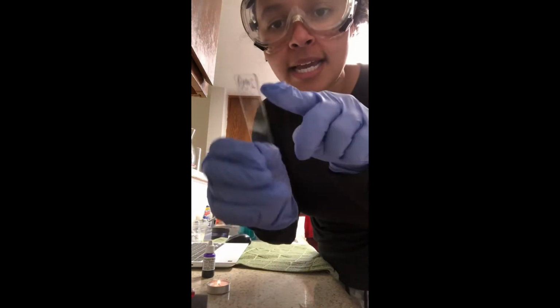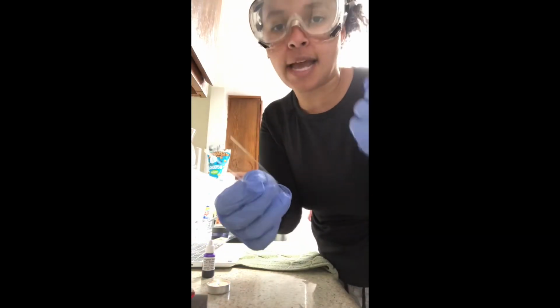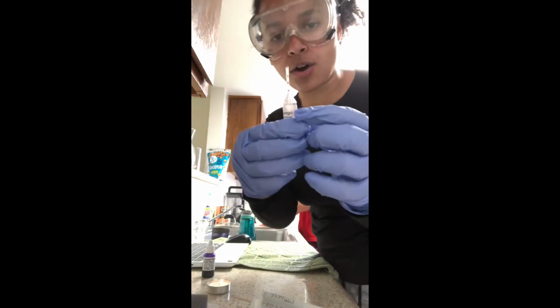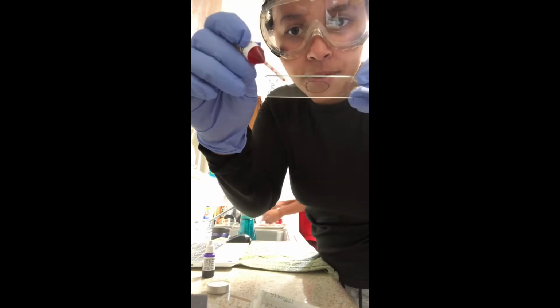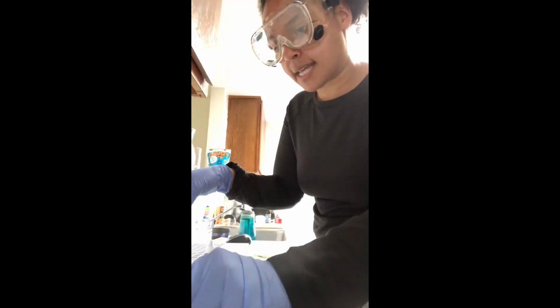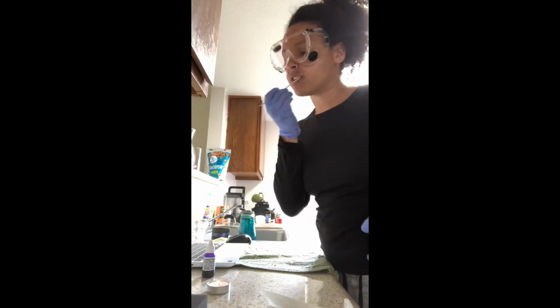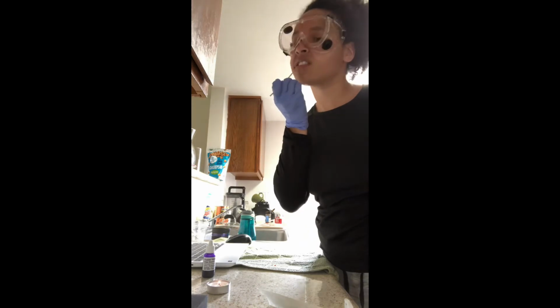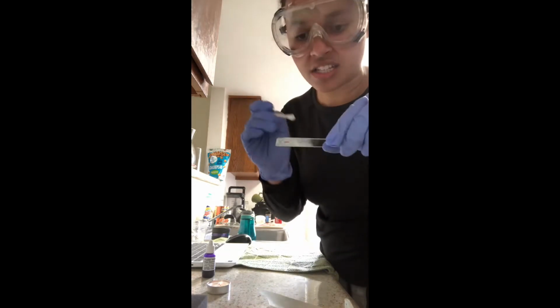And then on my second slide, it's labeled 2. It's a second slide, negative. It will involve a negative stain, and M indicates that the sample will be taken from the mouth. So what I will do is use my Congo red, which is a stain, and I'm going to place a single drop at the top, 1 drop. Then I will be taking my second sterile swab, and with the sterile swab, I will be smearing vigorously on my teeth and gums. And then I will be putting it on the stain in a circular motion.